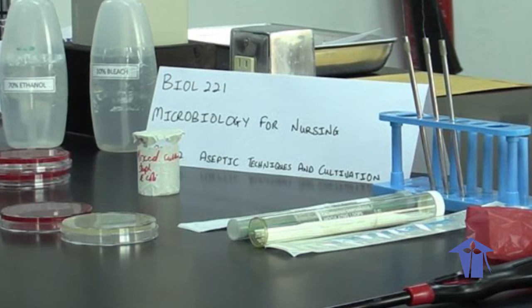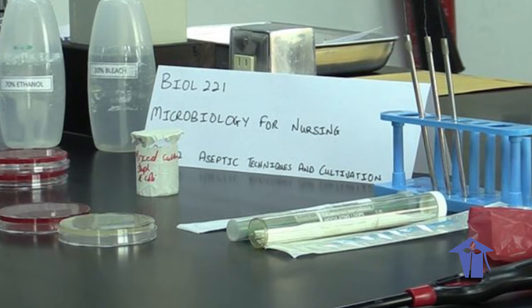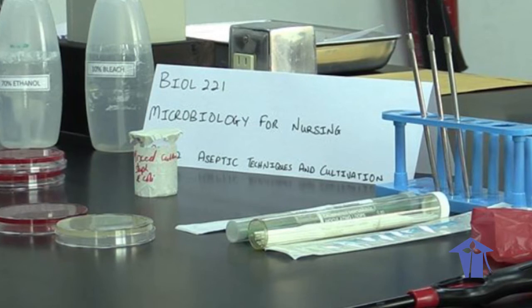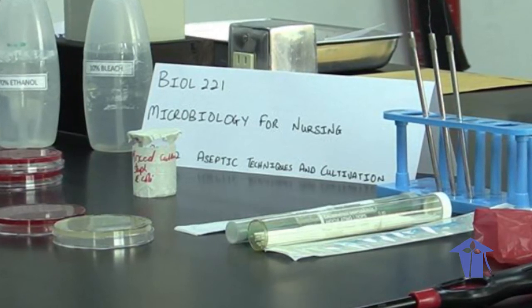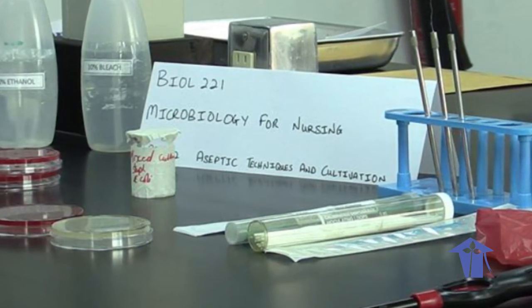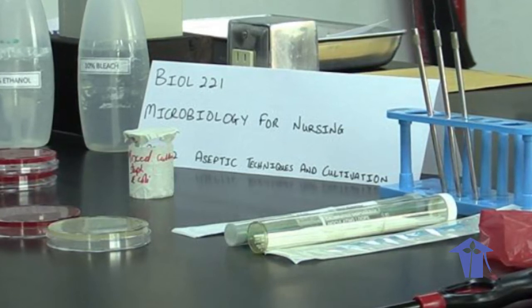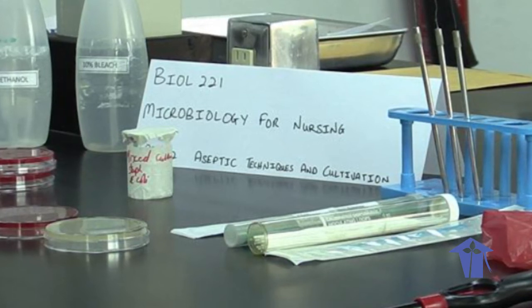Agar is a seaweed extract that melts at 100 degrees Celsius and solidifies at 42 degrees Celsius. The organisms don't break down the agar — it is literally just a solid substrate upon which the microbes grow. The nutrients that the microbes get are the nutrients that we put into the agar. In today's lab, we'll be looking at different types of agar and the different nutrients we put into it.